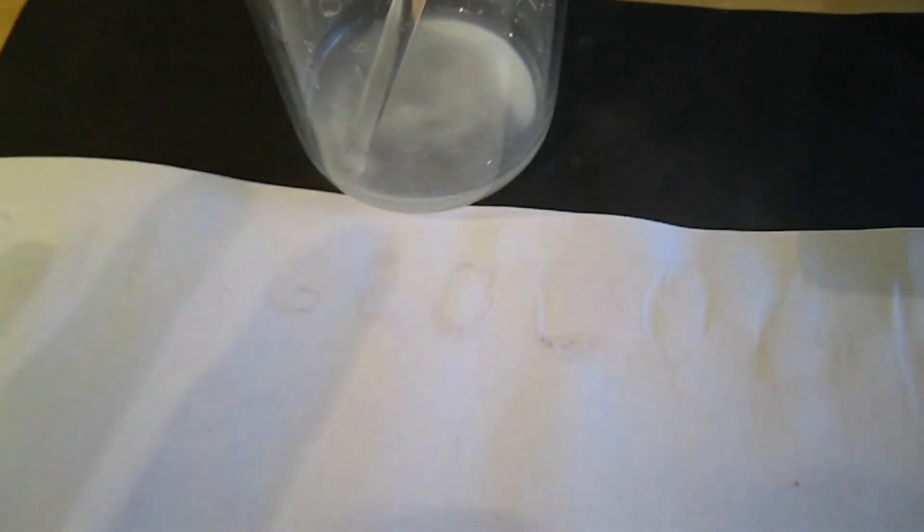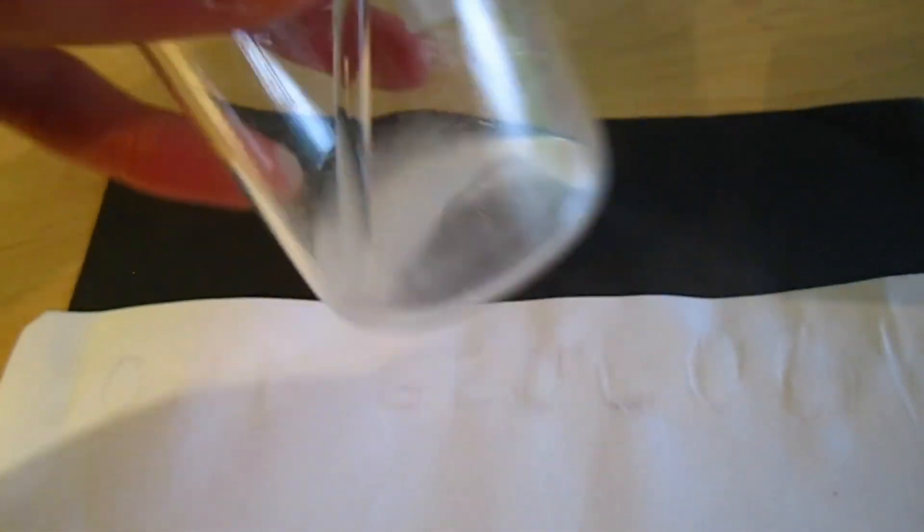I'm going to show you a pretty cool trick with gallic acid that you can do. I have some crude gallic acid solution here and I drew some stuff on the paper. You could probably see it because I didn't do it very well, but you could probably inject it into some washed marker casing and draw something nicer because I just drew it with my stirring rod.